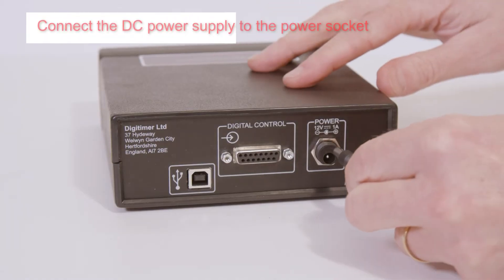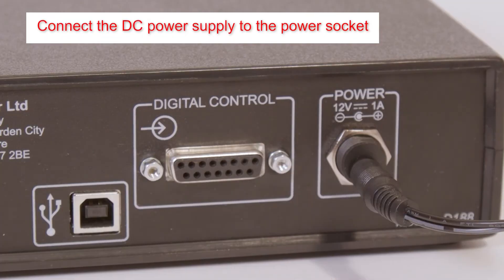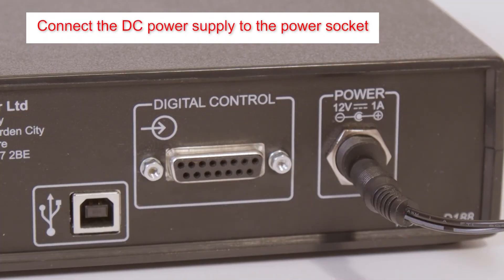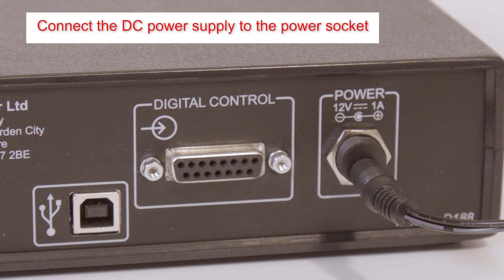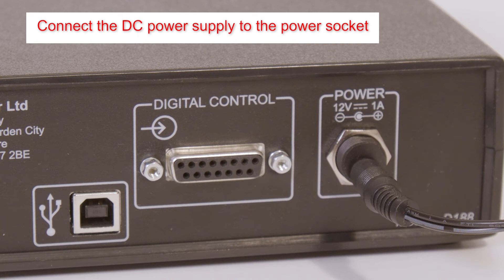Having fitted the appropriate mains plug adapter plate to the external DC power supply, connect the round plug at the other end to the power socket on the rear of the D188.